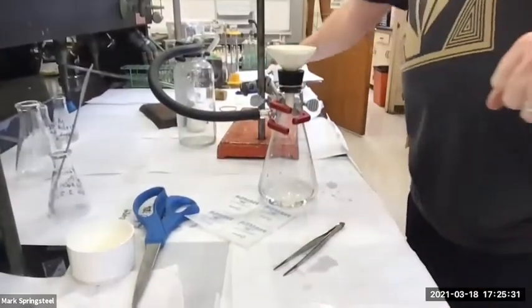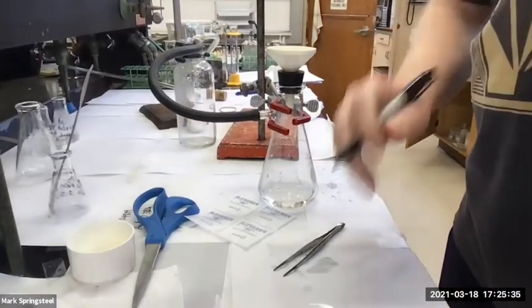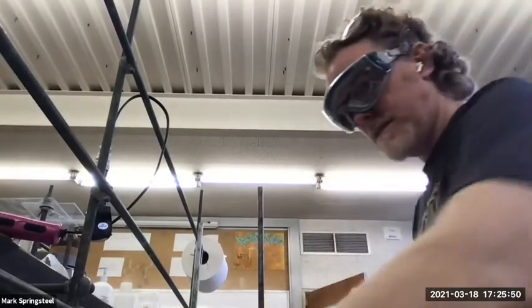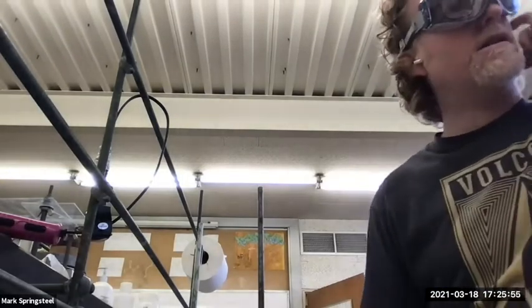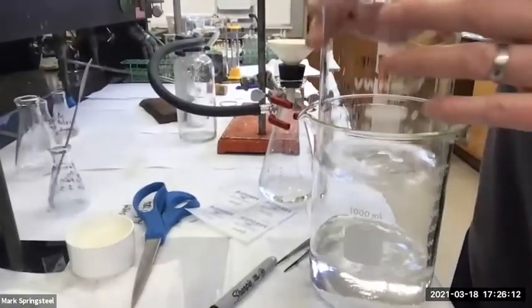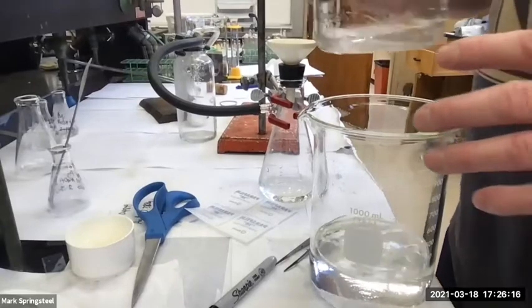Oh, I should have labeled this too. I'll label it underneath here. This is my acid, 21, got it. Okay, so I'll let that dry on its own, and let's go check out our evaporating organic layer. Still nested, and it's still got quite a bit. This was a larger scale evaporation.